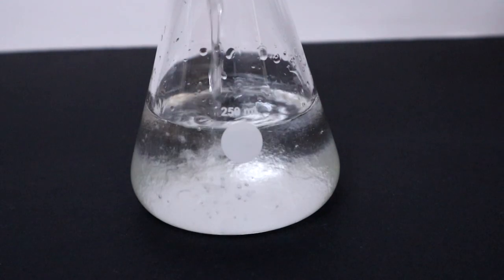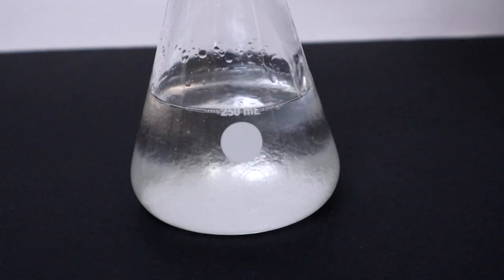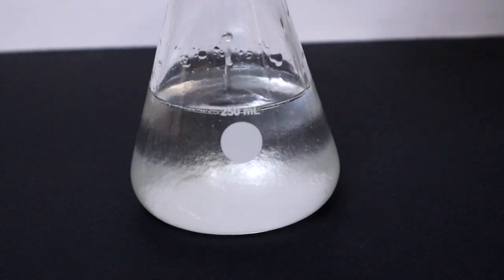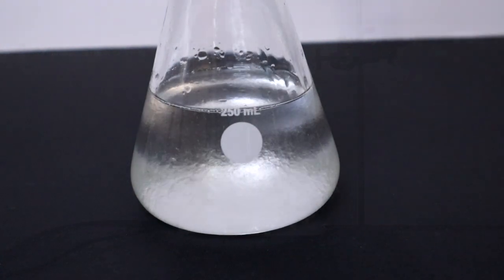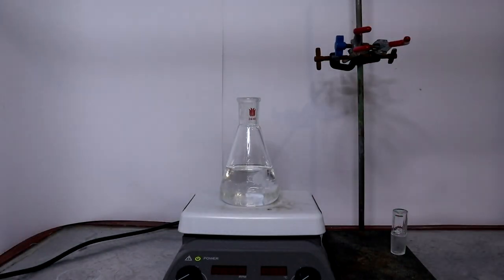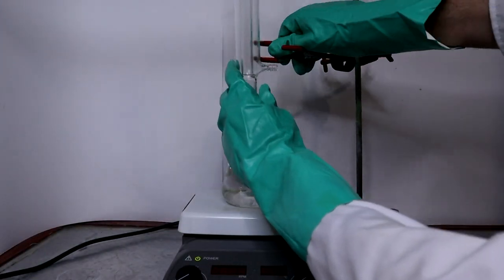As you can see, the two compounds are not completely miscible. Once combined, I then proceed to set up the mixture for reflux.